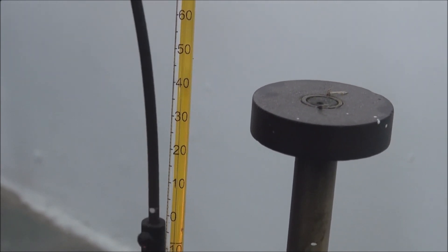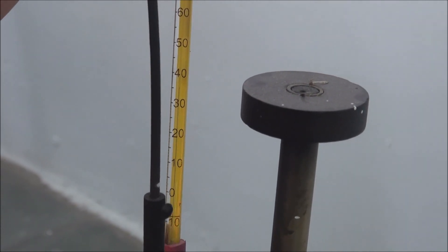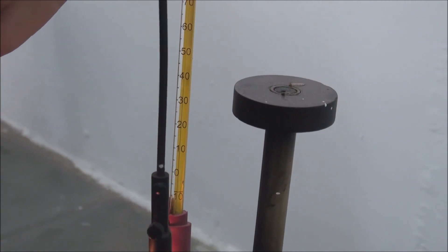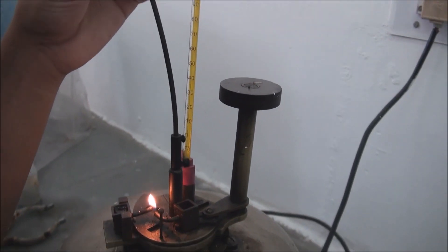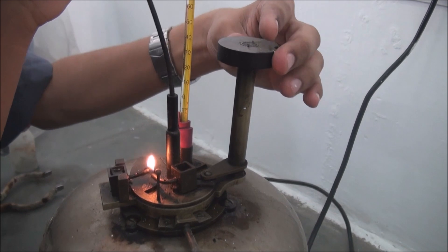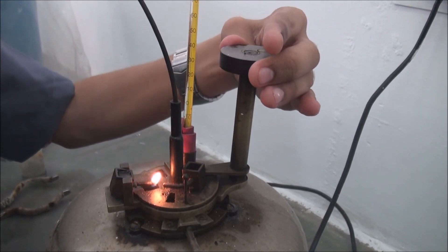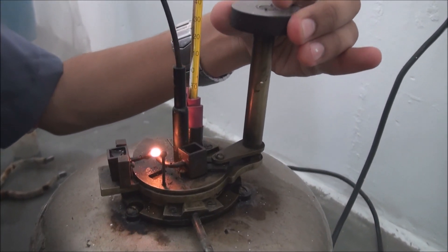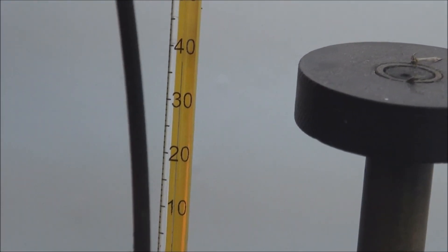And as the temperature of the lubricant rises, rotate the lid using the handle to check if the flash point is achieved. If not, continue the experiment and keep repeating the process after every 2 degree celsius change in the temperature.